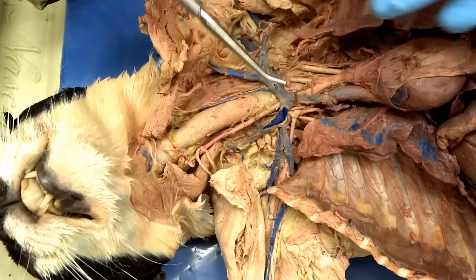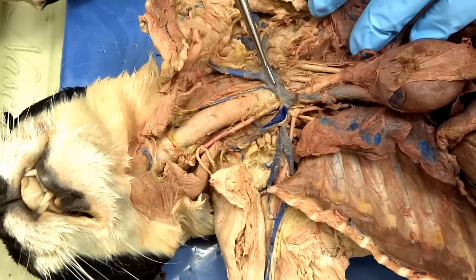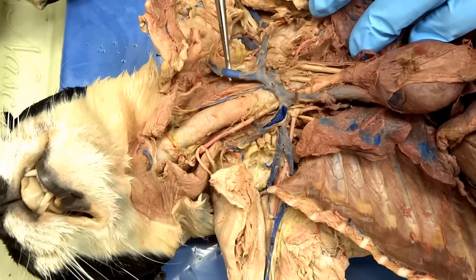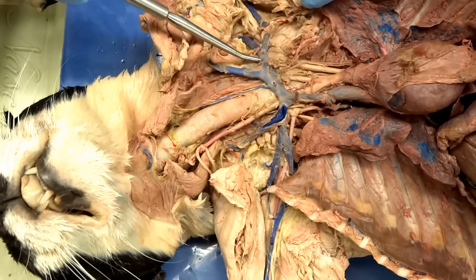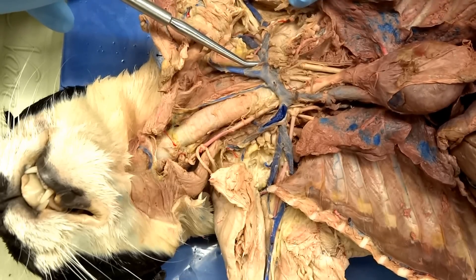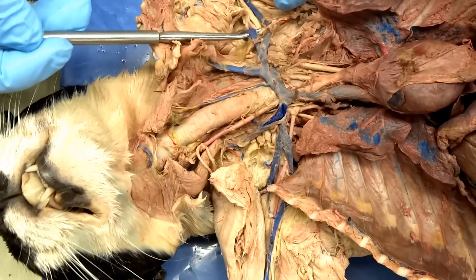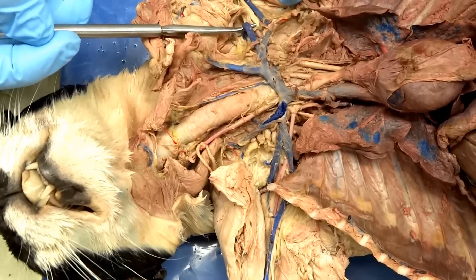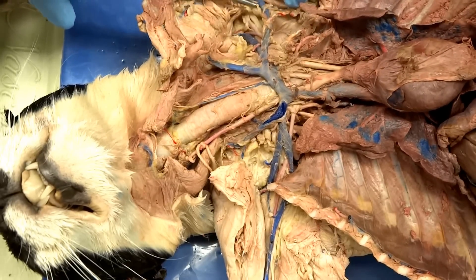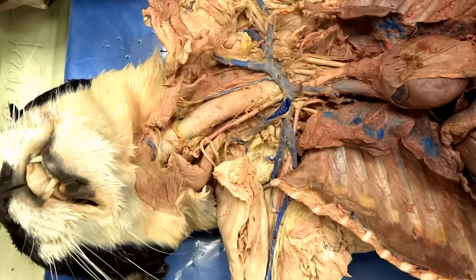Let's go the left side — the left brachiocephalic. The first big branch off of it is going to be the jugular, which will go up, or come down I guess, from the head draining the blood. The next section is going to be our subclavian vein. The subclavian is also going to have a branch all the way to the back, which will be the subscapular — that goes over to the scapula. And then the left axillary vein and the left brachial vein, which will be pulling blood back from the arm.